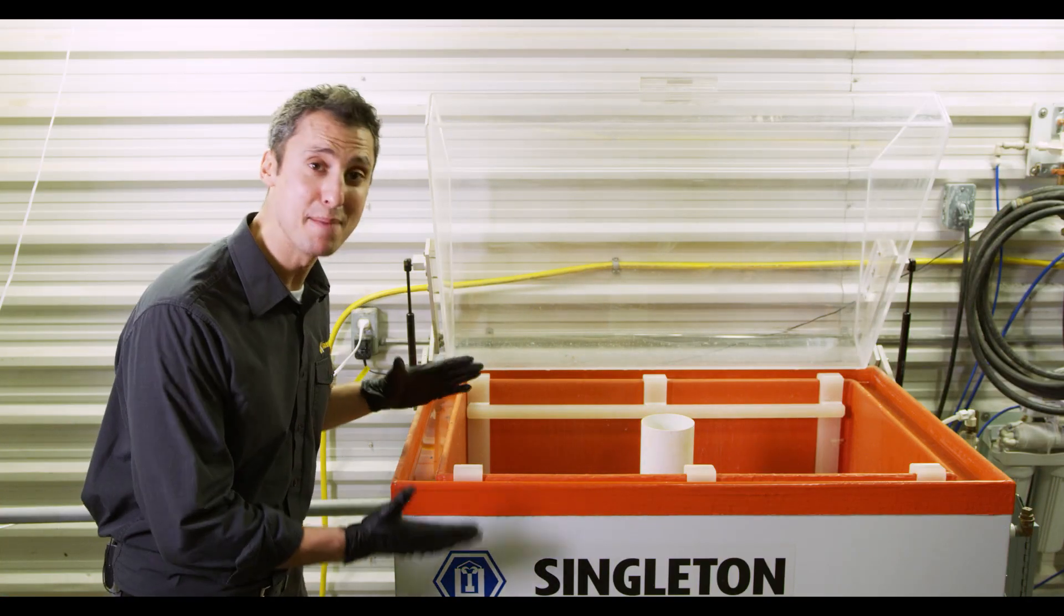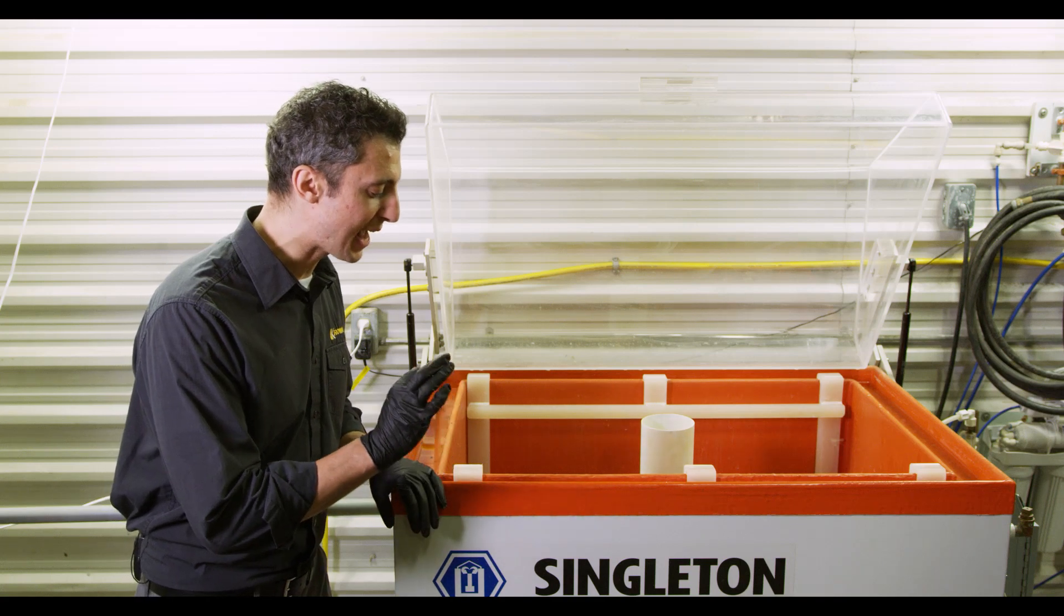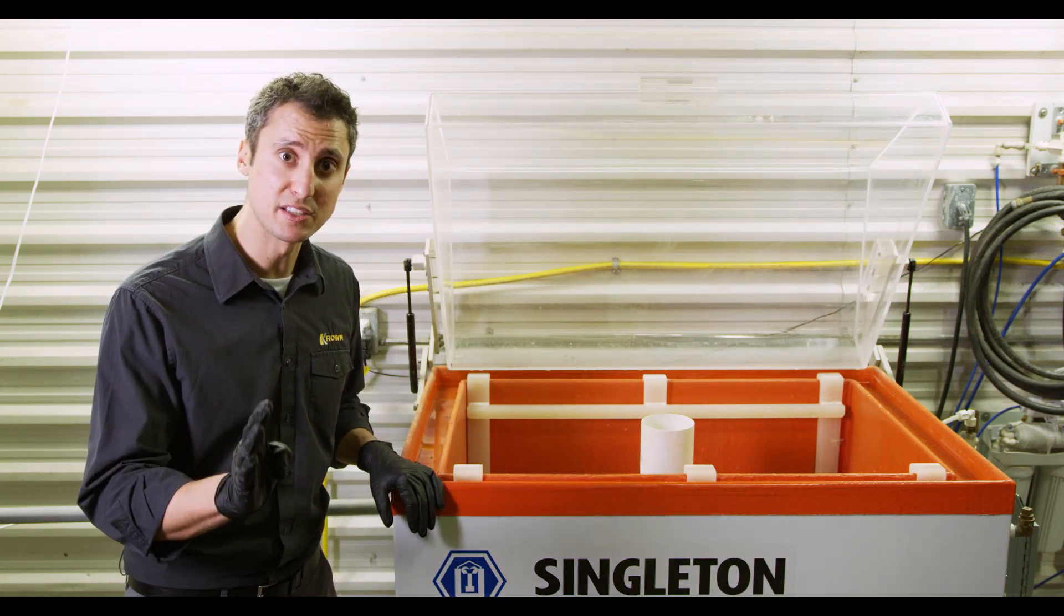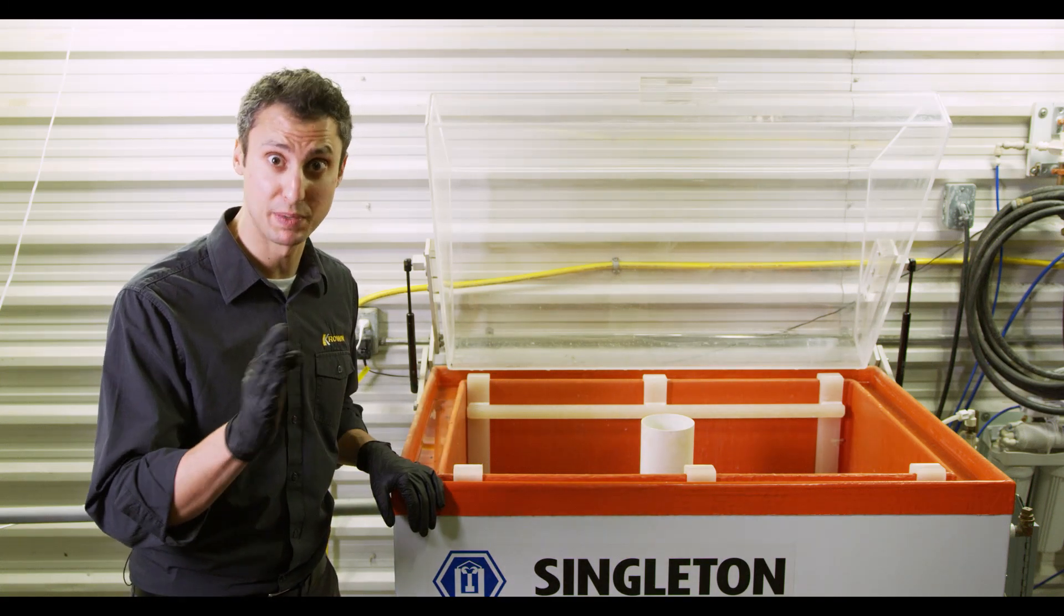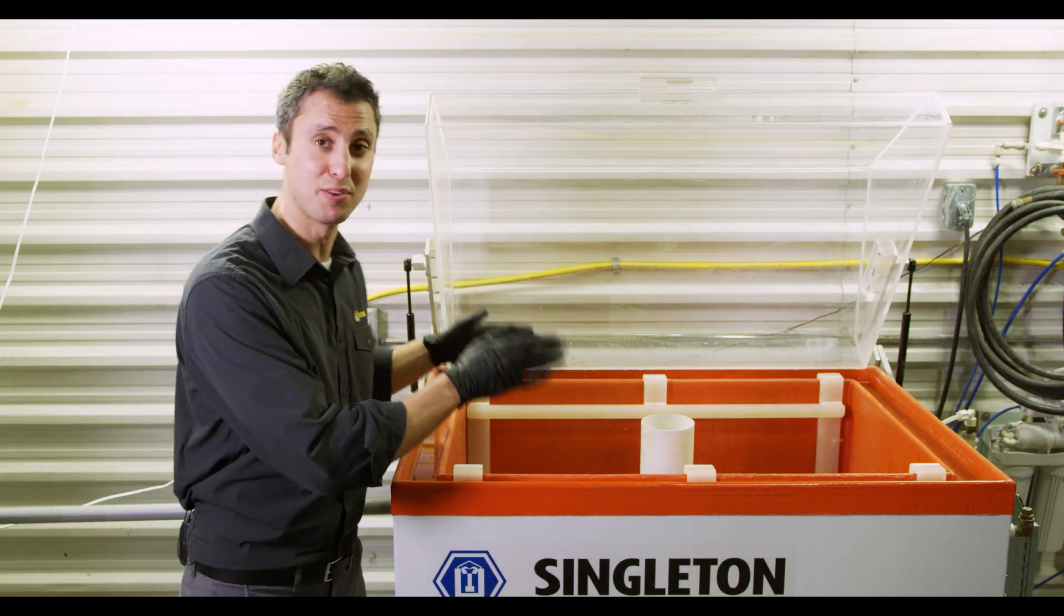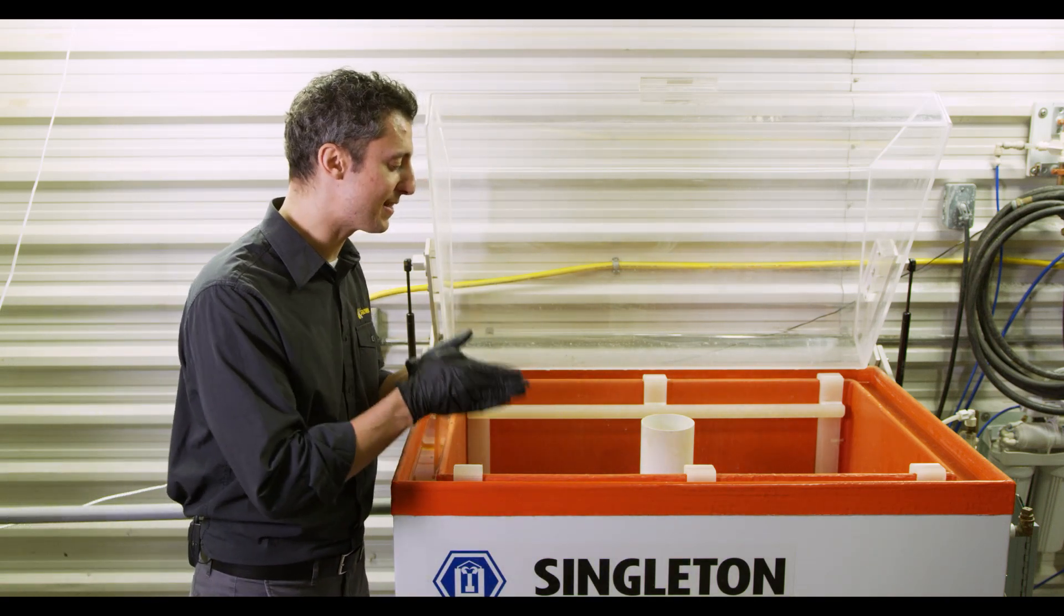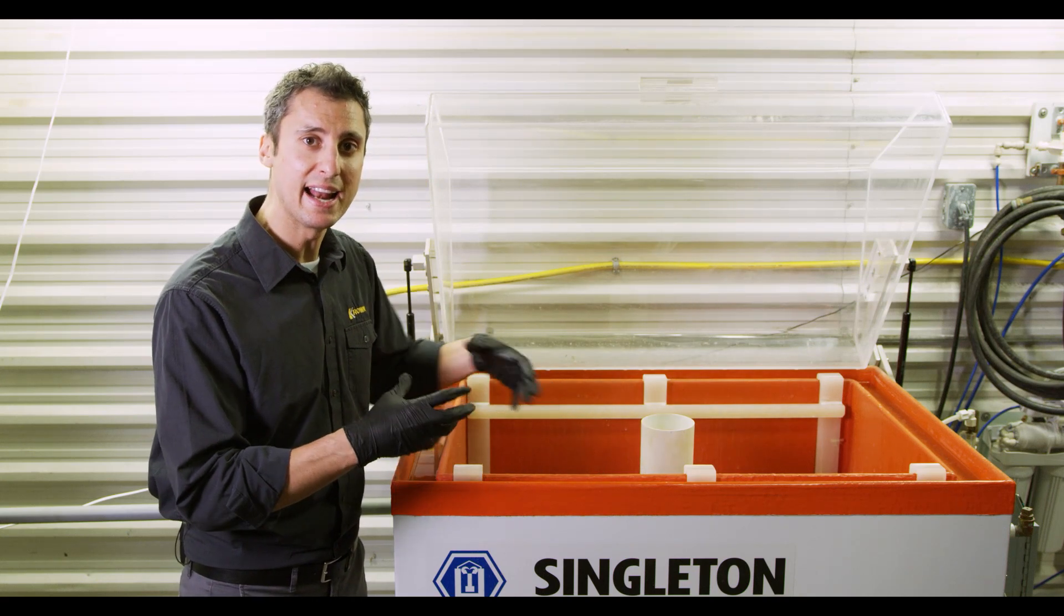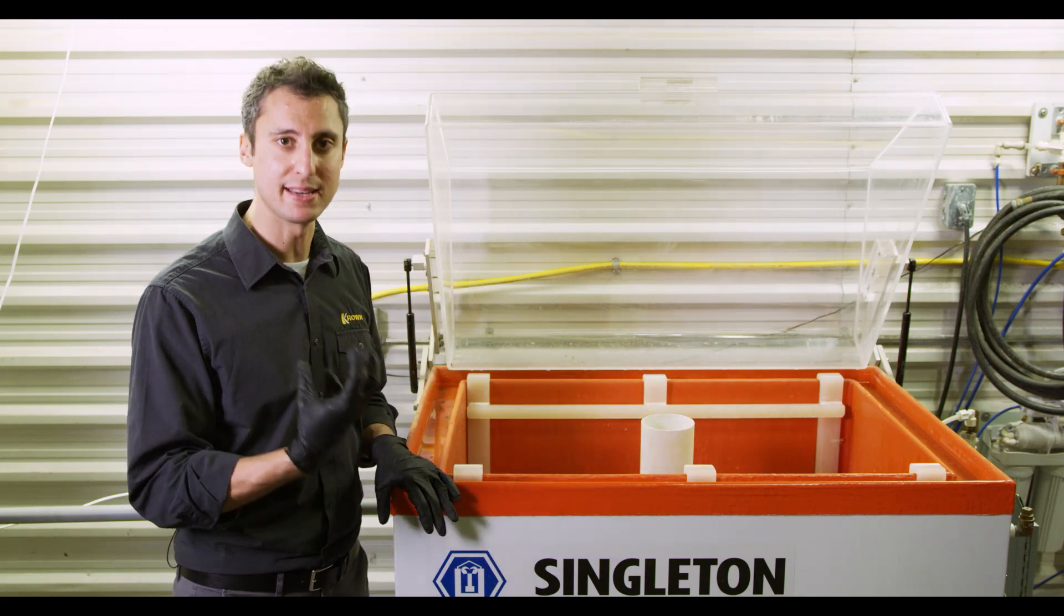Here's our salt spray cabinet. Currently it is calibrated to meet the manufacturer's specifications to run or perform this particular test. To walk you through exactly what's going to happen, we're going to take our different samples, we're going to line them up here in the cabinet, and then this cylinder in the center actually pumps out a salty mist.